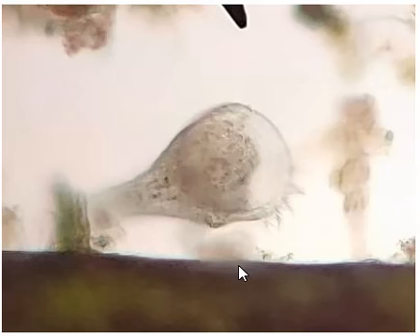Stentor is a protist ciliate, and I was thrilled to gain enough resolution to see some of the oral cilia along the lower rim. It is trumpet shaped, and I usually think I identify this organism when it is sessile. That means fixed in place. Usually it will anchor and then pivot around and feed in the surrounding environment.